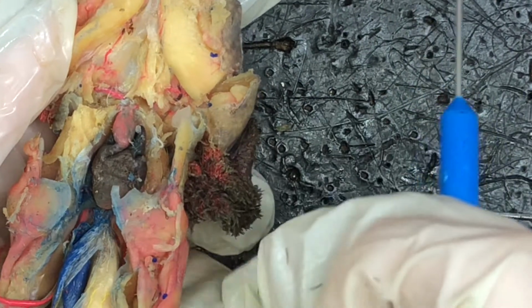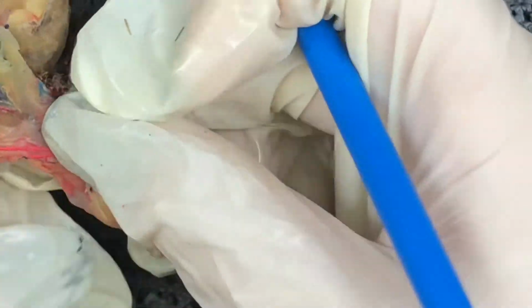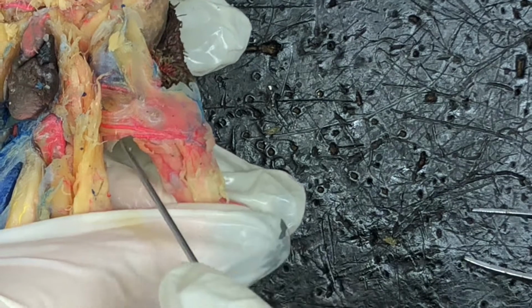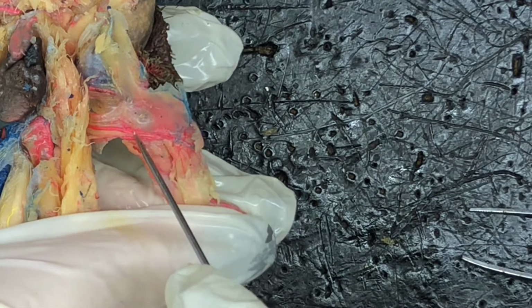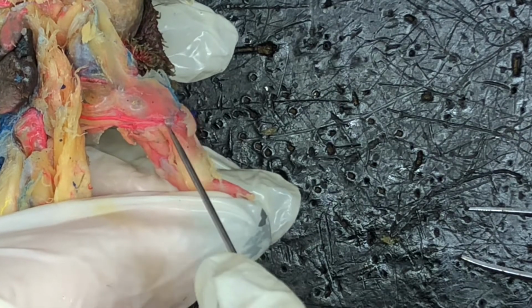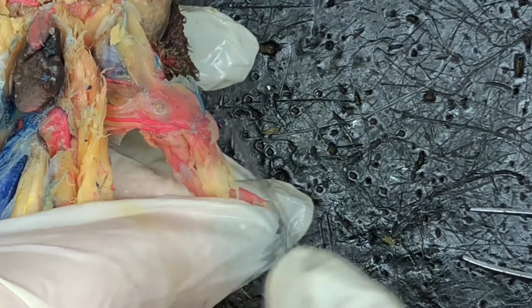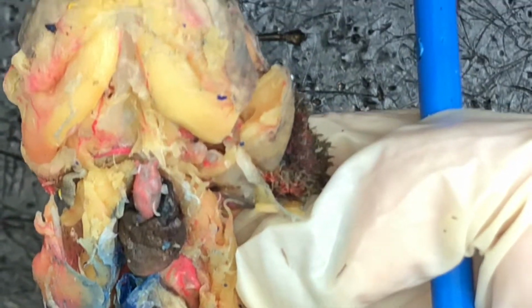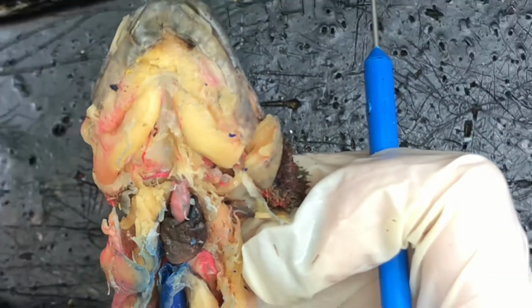Going down, we have some arteries in the arm. First it's the subclavian, and these are really just regions. So the subclavian, right about here would be the brachial artery, and then the cutaneous is the furthest up. So we're going to zoom out a bit. Let's see if we can zoom out.